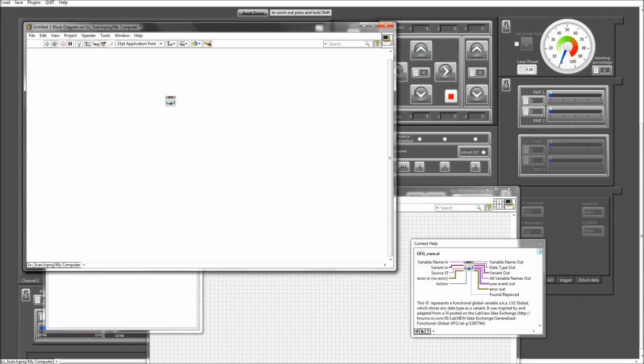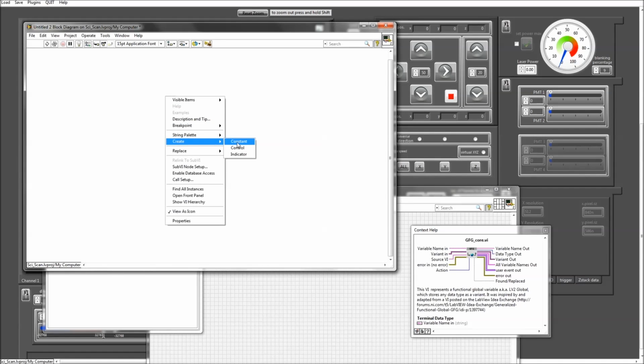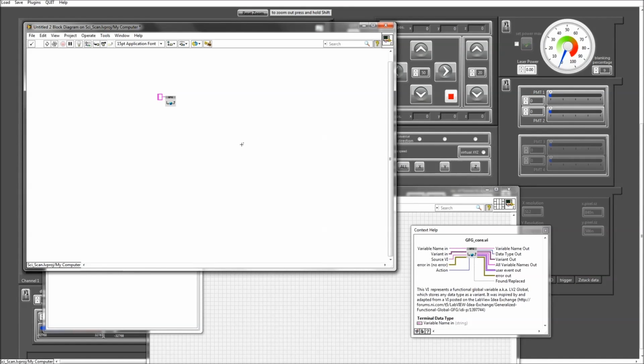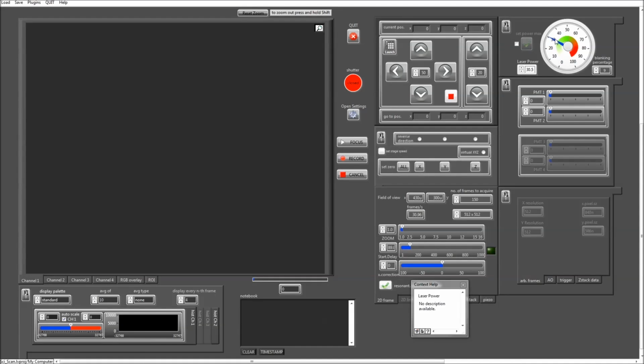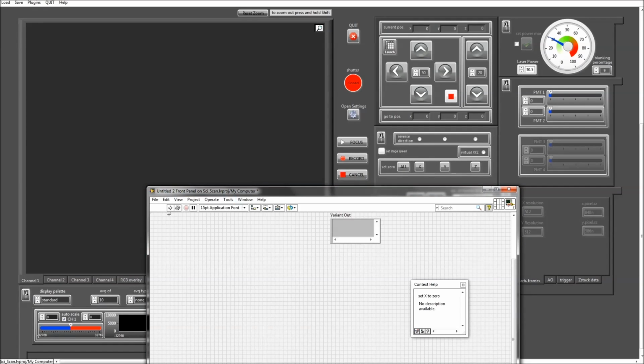and let's say you want to read out what the laser power is. So all you need to do is give the variable name here. The variable name for all these front panel elements is the same as the title of that front panel element. So in this case it will be laser power, and then I would need an indicator, obviously. In this case it will be a variant out, and if I set that laser power to whatever value in SciScan, in my new standalone VI, I have access to that value now. If I read that out, it'll show me it's at 30.5, and if I change that value to something else, if I read that again, it has access to that value.